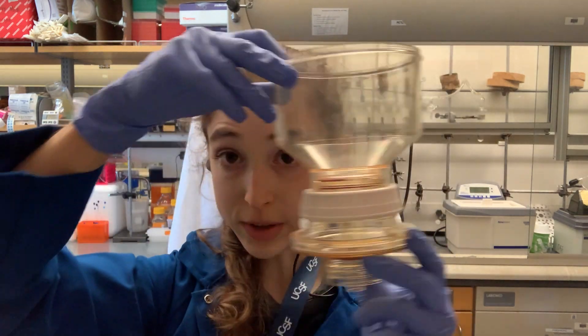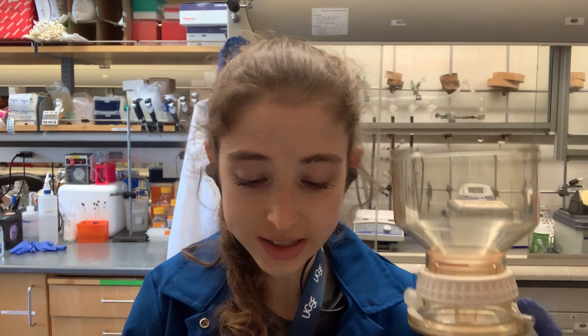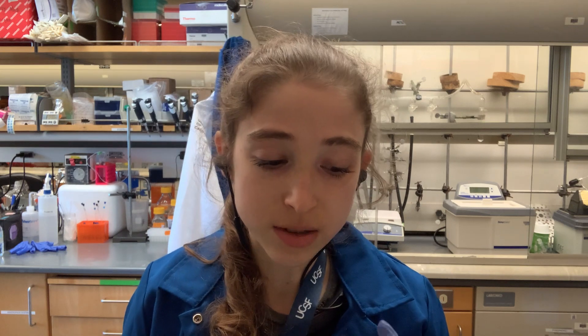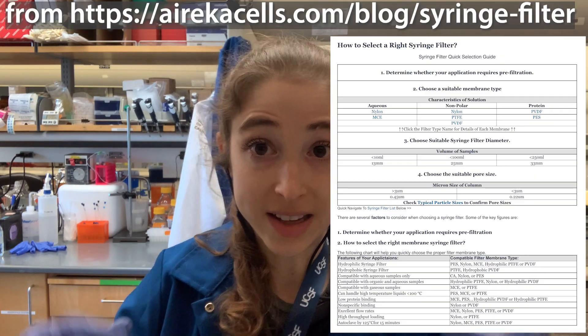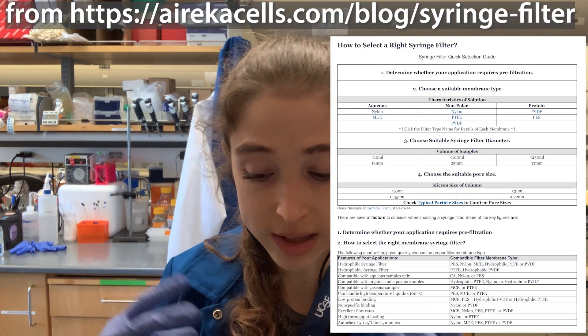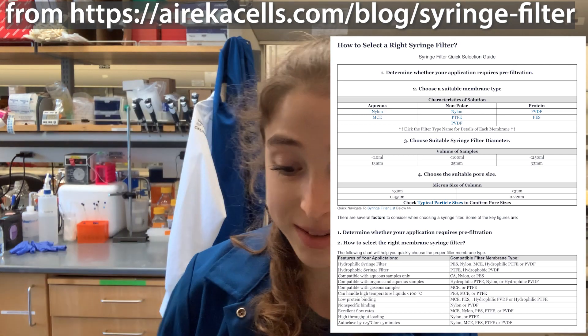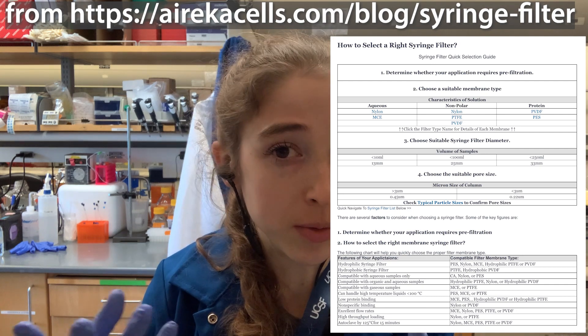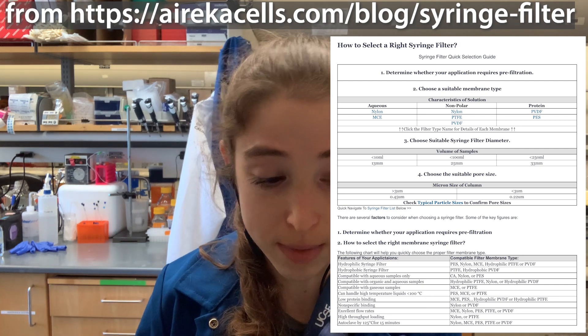There are also reusable ones — these aren't sterile — and they come with different membrane options. For all of these you're going to have to choose your membrane based on what you're filtering. In biochemistry we're typically dealing with aqueous, water-based solutions, so we want a hydrophilic membrane. If you used a hydrophobic membrane, the water would be repelled and it would be really hard to push things through. If you're working with an organic solvent, your membrane choice would differ.